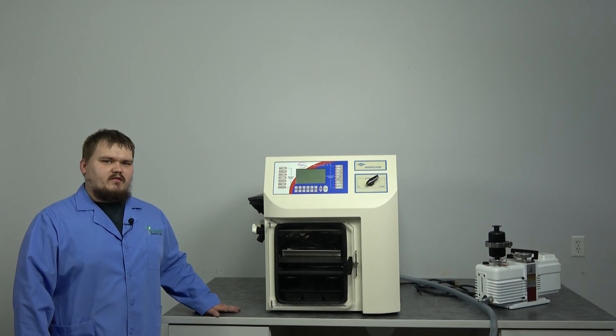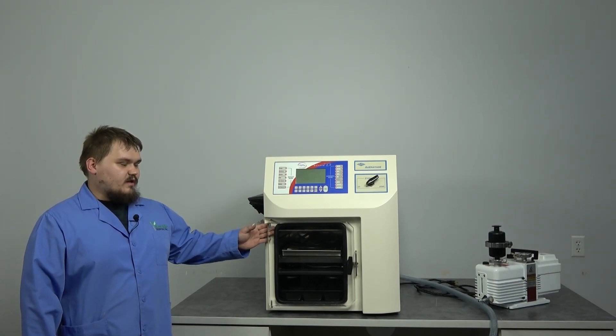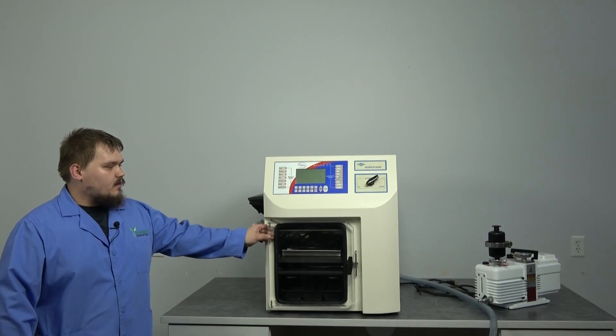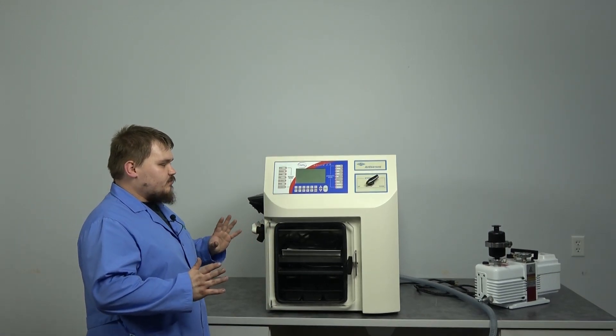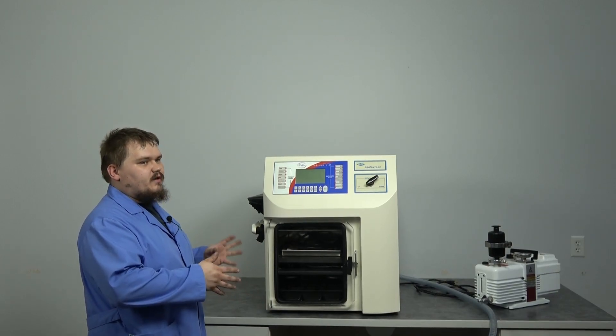Hello, I'm Dimitri from New Life Scientific, and today I am showing you an XL70 here—not exactly the machine itself, but more or less the process of setting up and installing it.